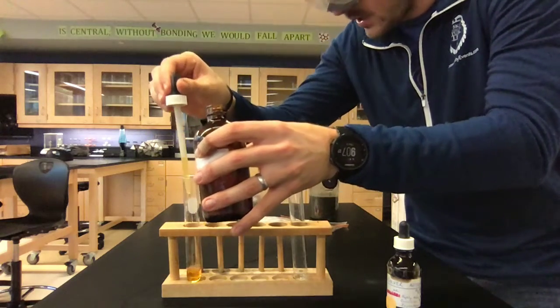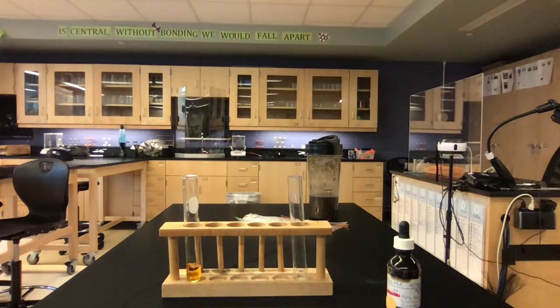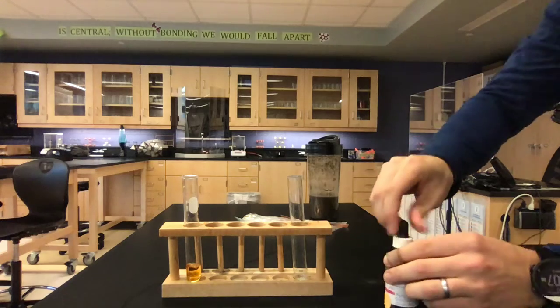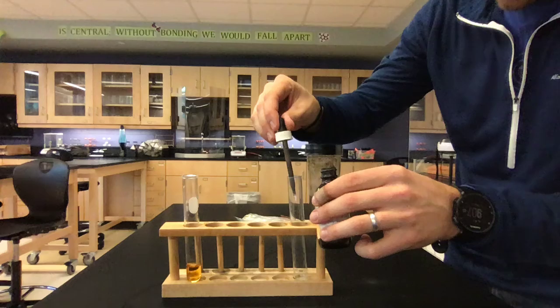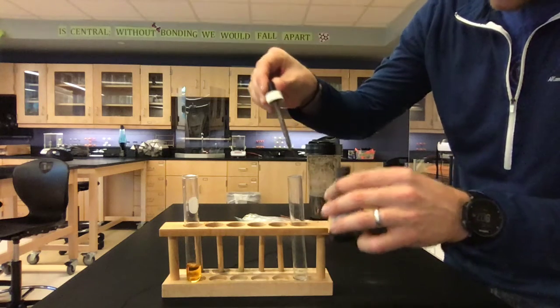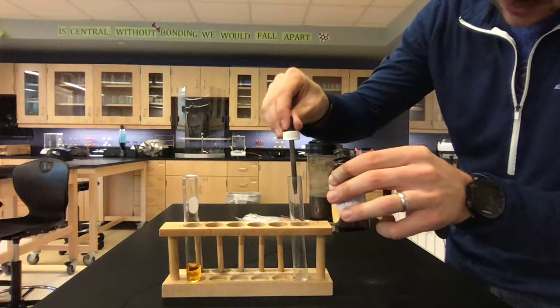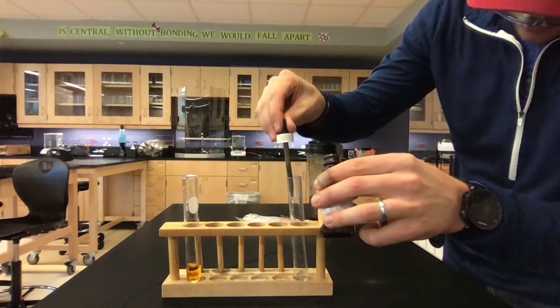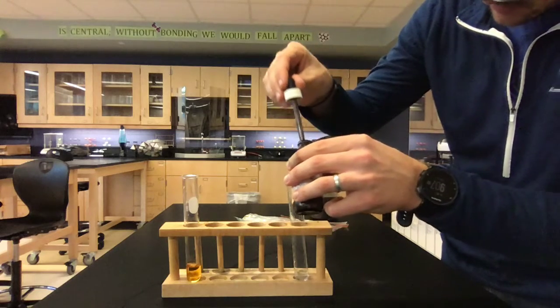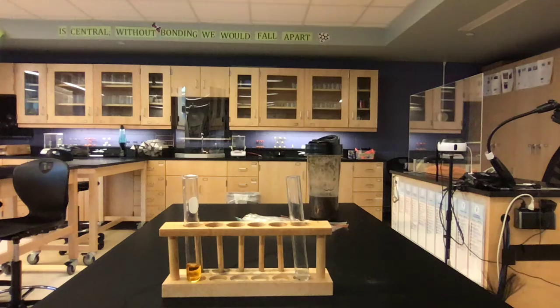So I'll put enough to cover just the bottom of the copper when I put the copper down. Remember, that's the iron 3 nitrate that you're seeing there. And then right here, I'm going to go ahead and use some silver nitrate. The stem of this thing is all junked up, but the solution itself is rather clear. So let's go ahead and put a few more drops down in there just to make sure we get the base of the copper covered. And we put it in.